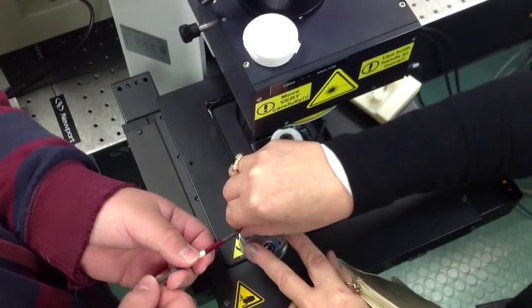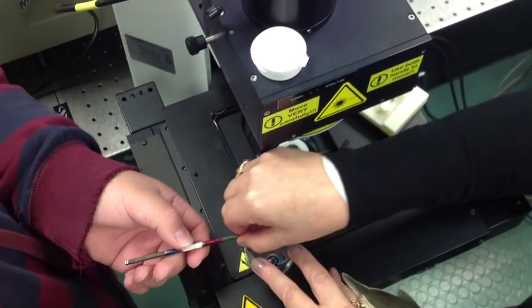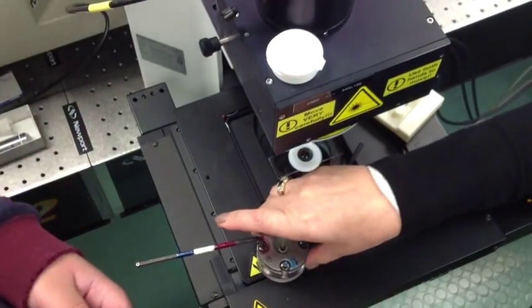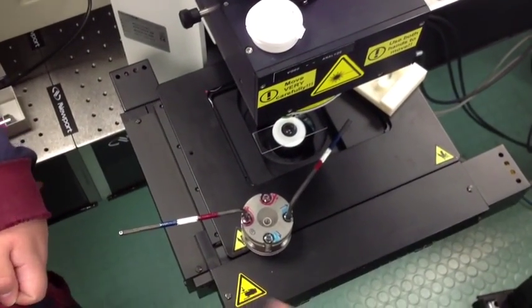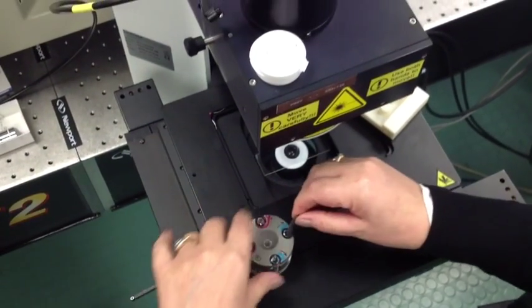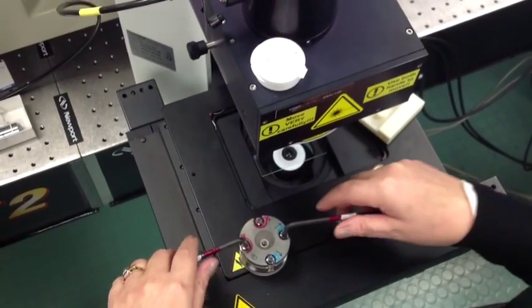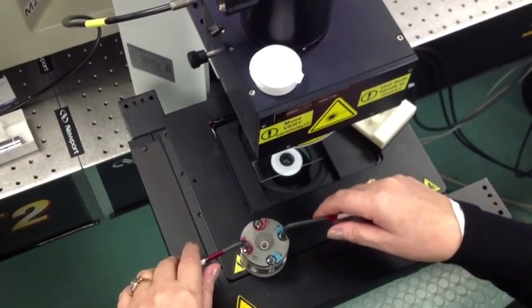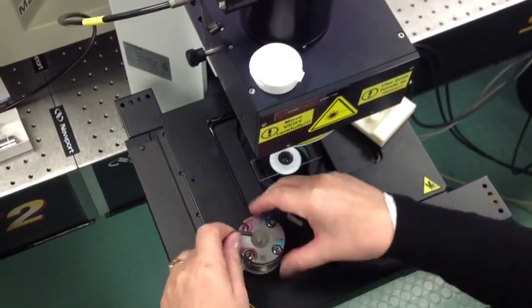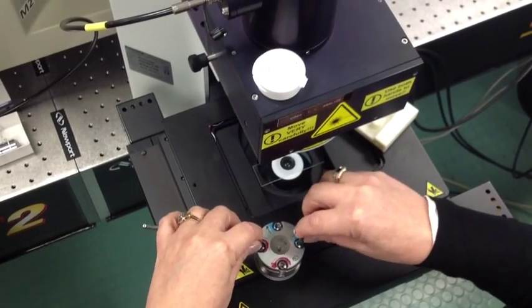At the FameTech Lab here at UNLV, pressure is increased in the diamond anvil cell by first removing the cell from the viewing stage and then tightening, by hand, four independent hex head screws, two left-handed and two right-handed, simultaneously with equal rotation. Failure to do so can result in shattered diamonds.